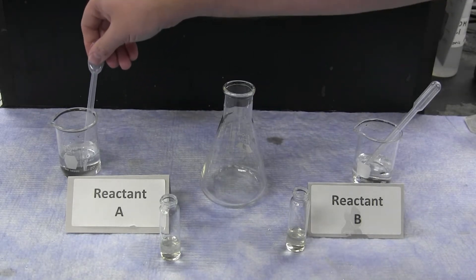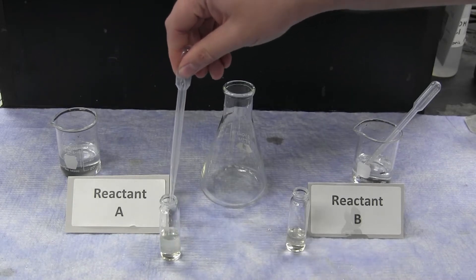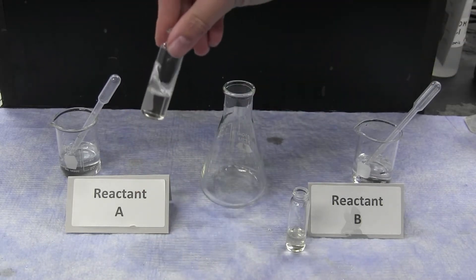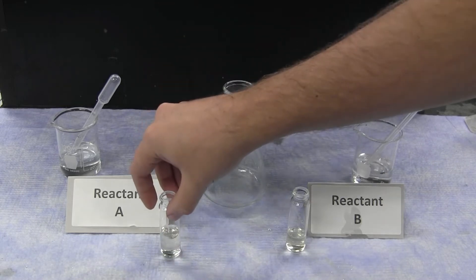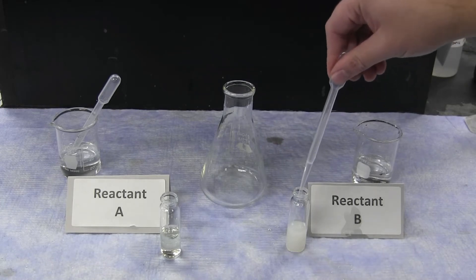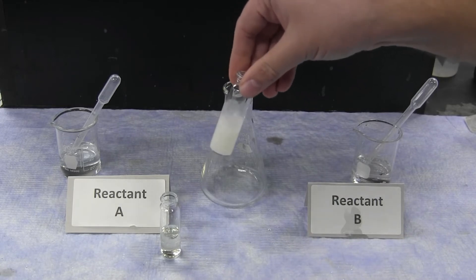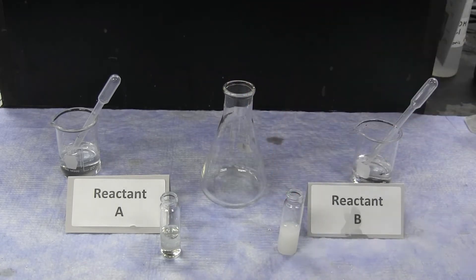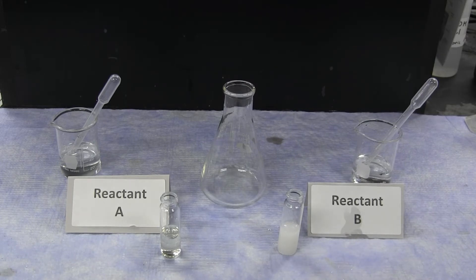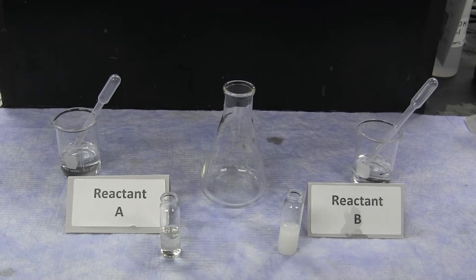Initially, when reacting with reactant A, there is no precipitate formation and the solution is still a clear and colorless liquid. When reacting with reactant B, a white precipitate is formed indicating a reaction. Based on these observations, you should be able to identify the identity of the limiting reactant that was in the original reaction.